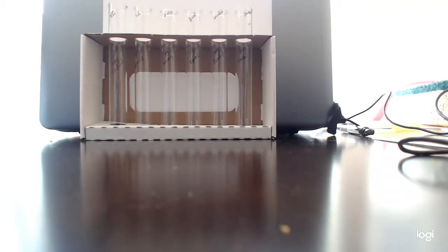You'll notice that there are pairs of tubes, so the leftmost tube for that assay is going to be the negative control, say for potassium iodide, and then on the right is going to be the positive control for the same test. So these are for starches. This is going to be the negative control for protein, positive control for protein, negative control for sugar, positive control for sugar or for carbs.